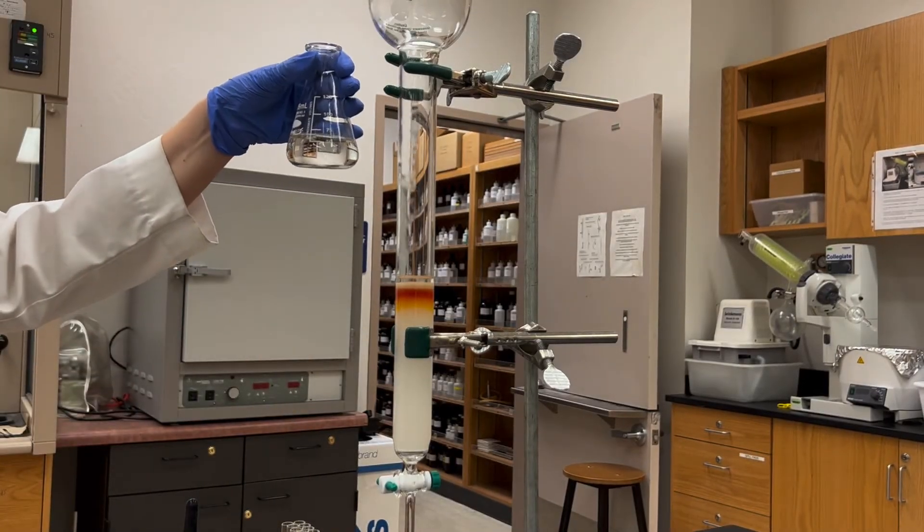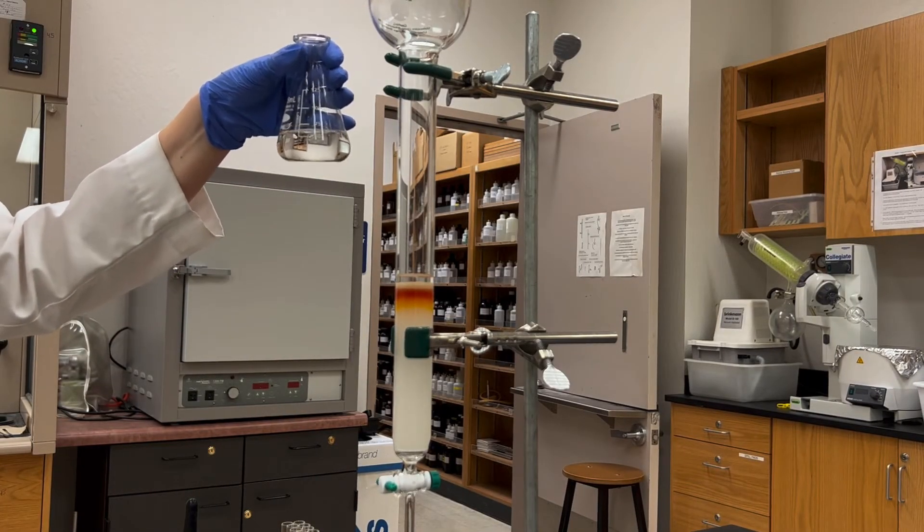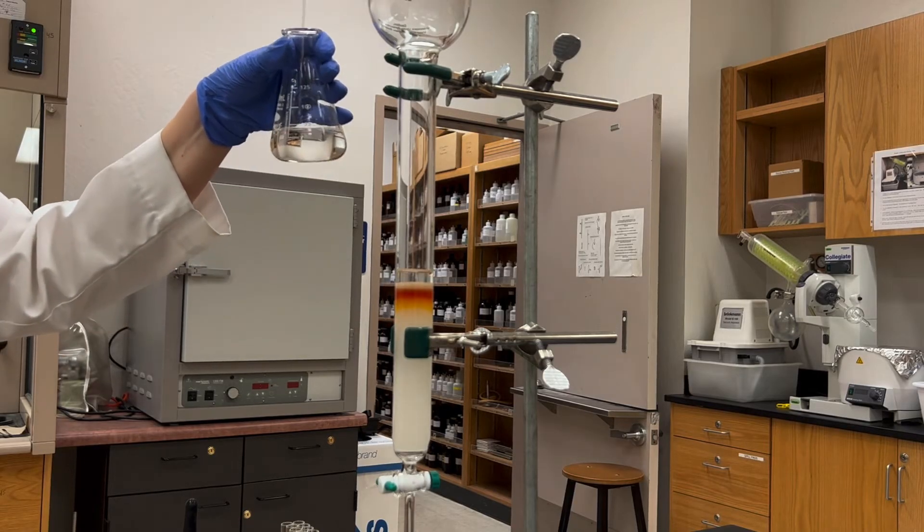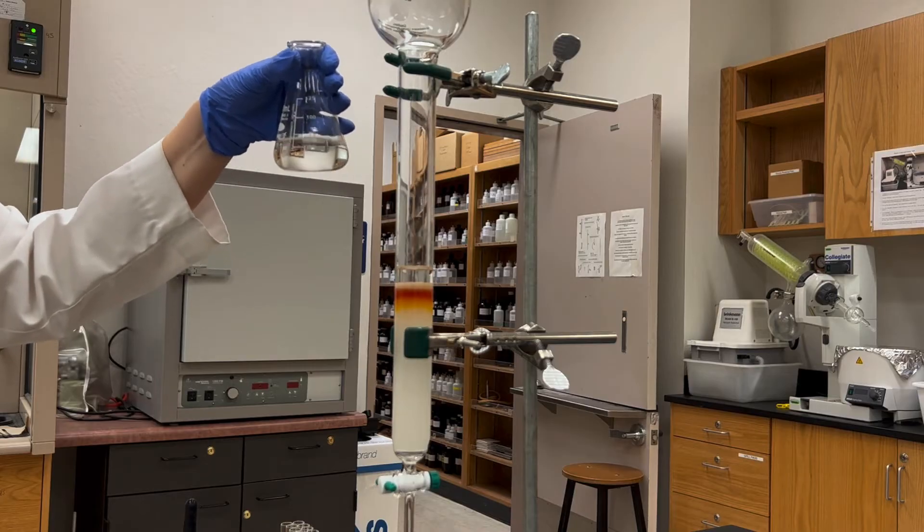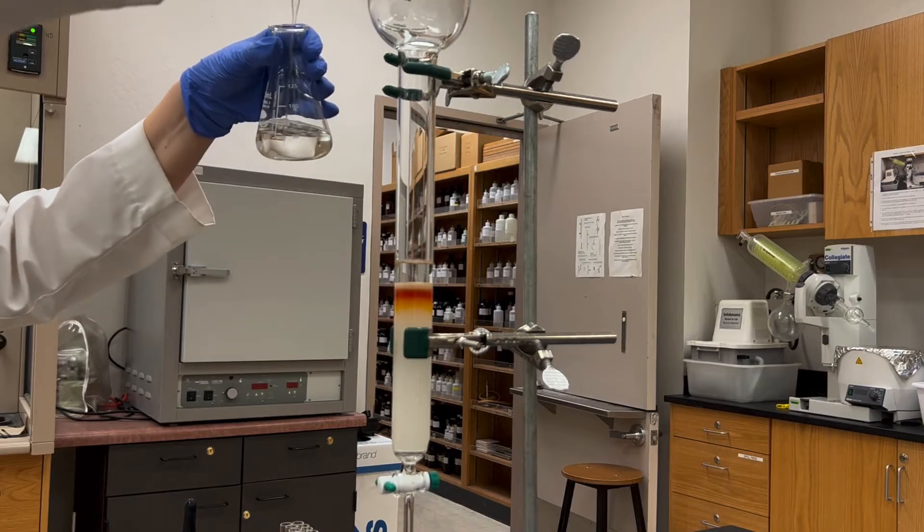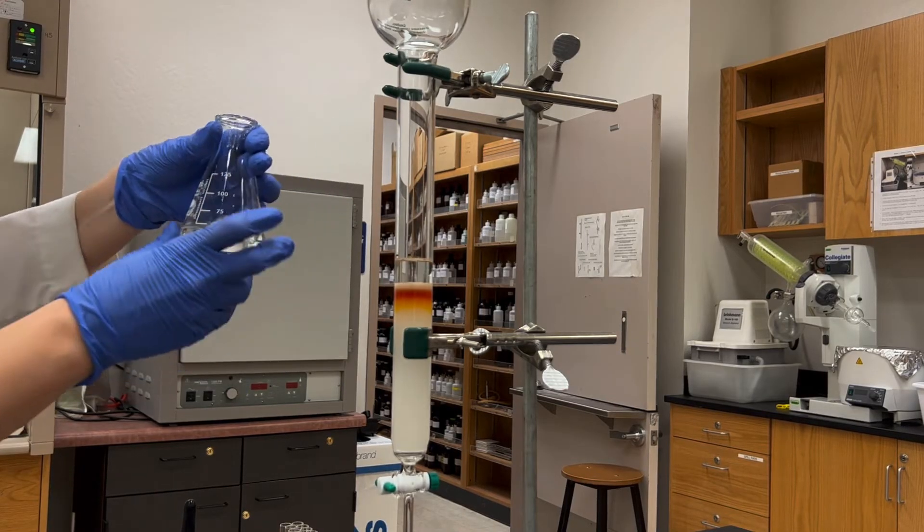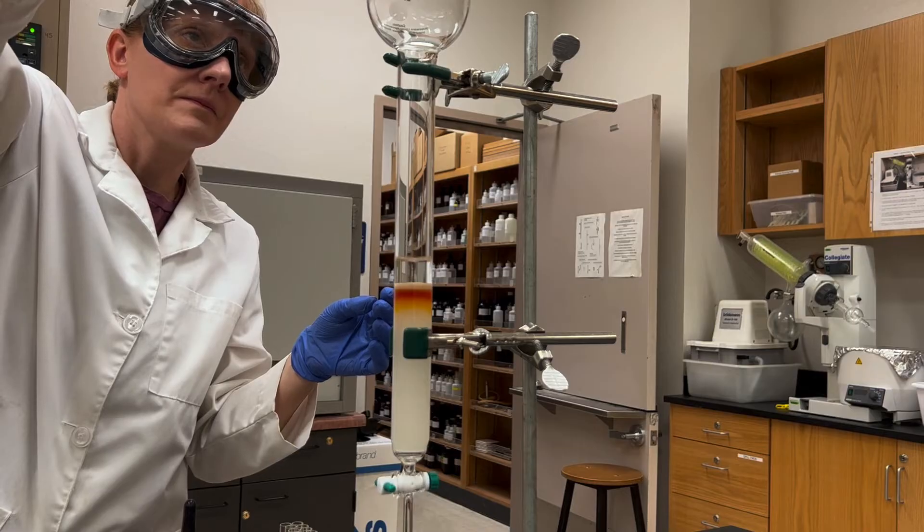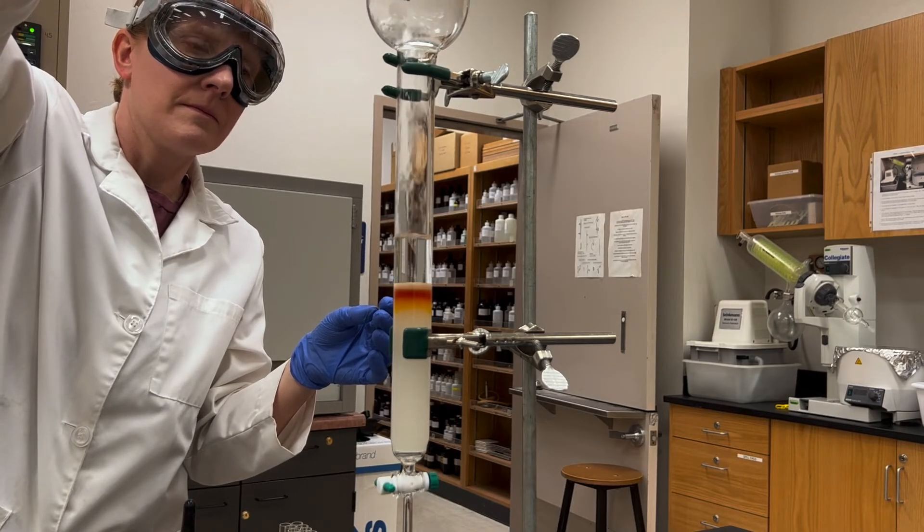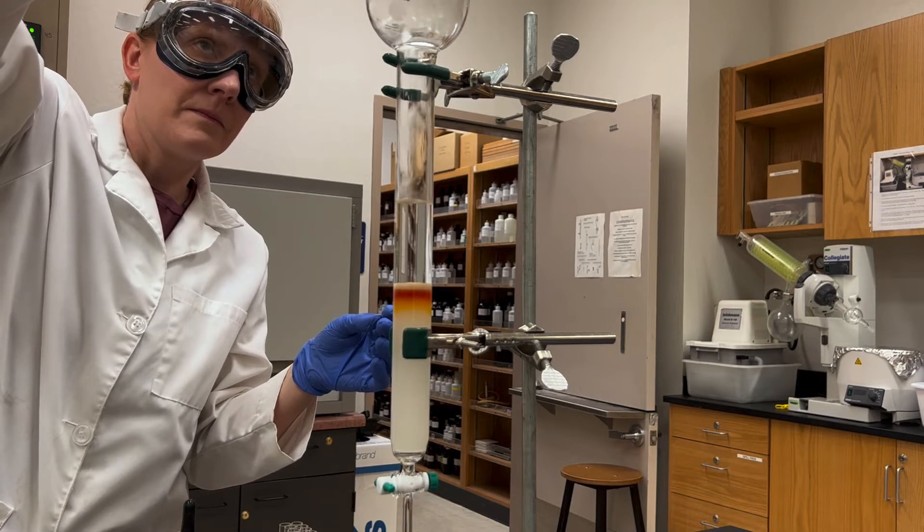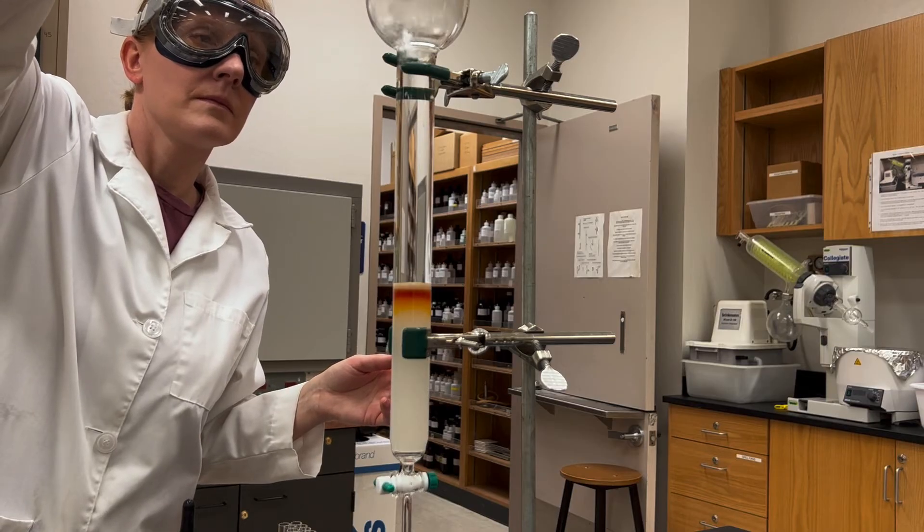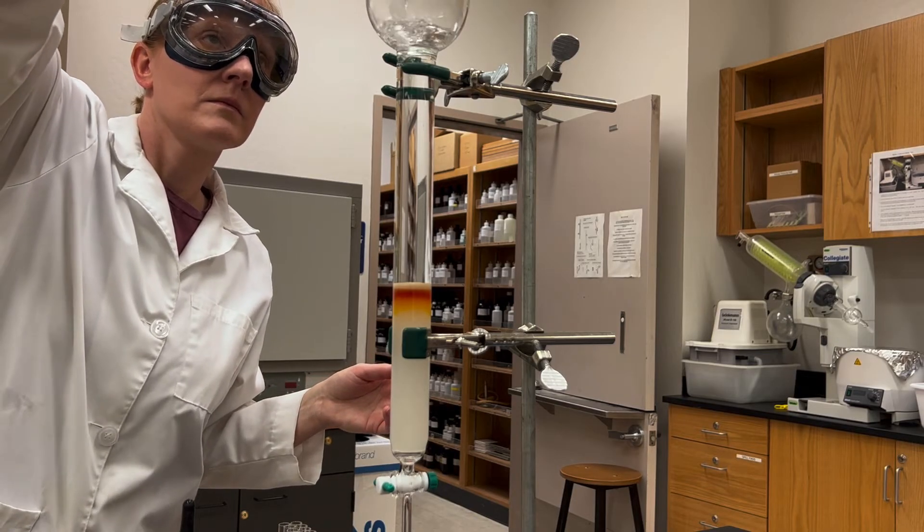Now I want to add extra solvent to the column and when the solvent level is so low and it's real near the sand layer, you have to do this carefully. You want to add solvent with the pipette and just rinse it around the sides. Eventually once your solvent level gets high enough you would be able to pour it out of the flask and at that point you wouldn't be disrupting that column level. Just fill up the column even up into the bulb area, fill that up with solvent so that you won't have to refill while you're running the column.